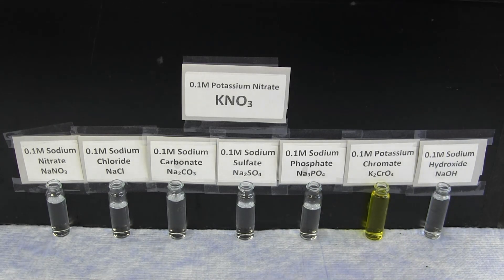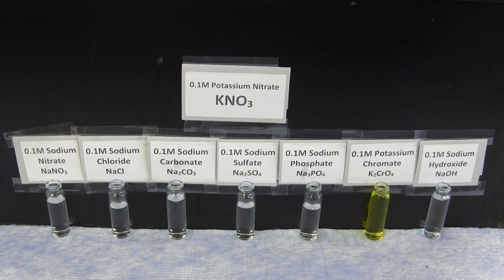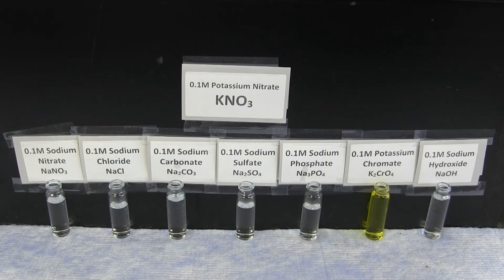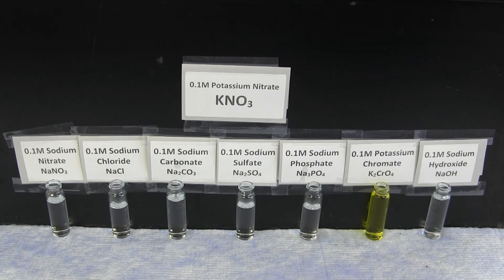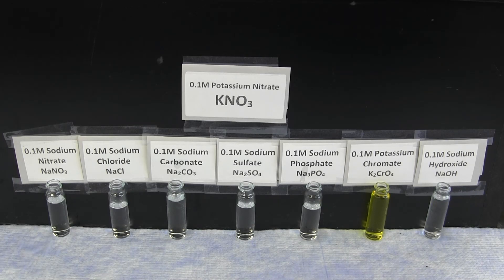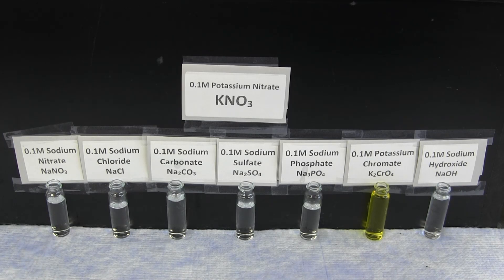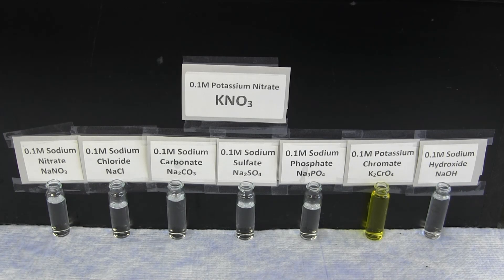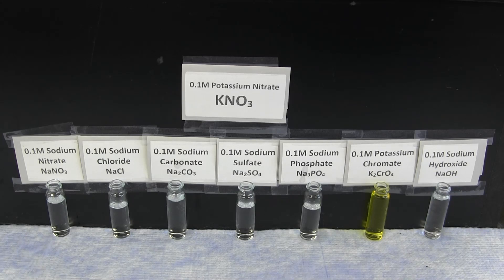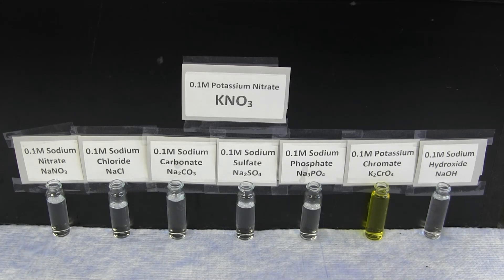For the potassium ion, there are no observed reactions with any of the reactants. There is no reaction with sodium nitrate, sodium chloride, sodium carbonate, sodium sulfate, sodium phosphate, potassium chromate, or sodium hydroxide.